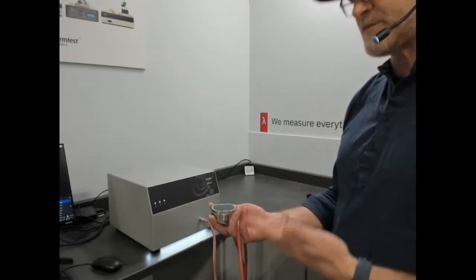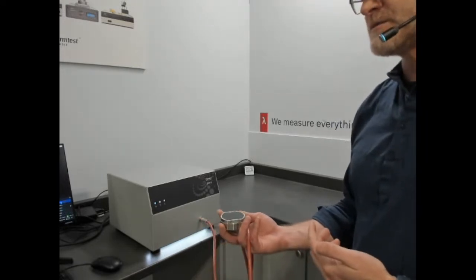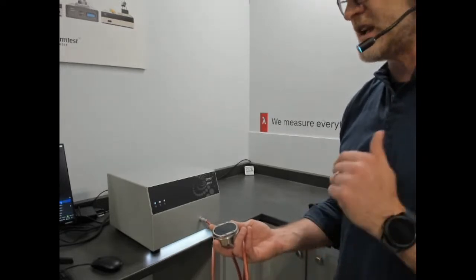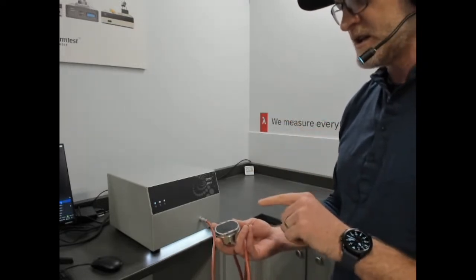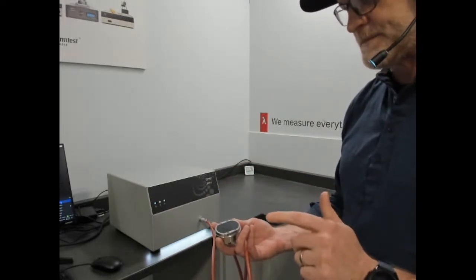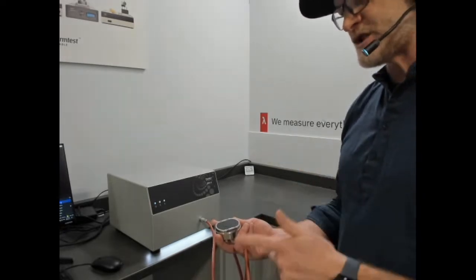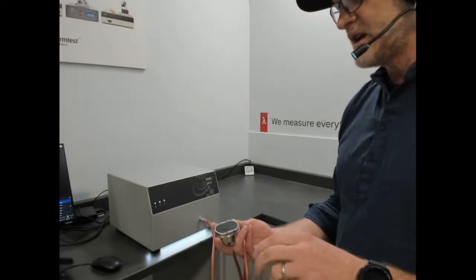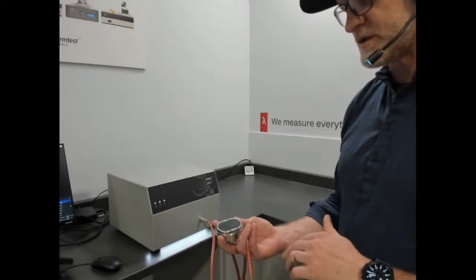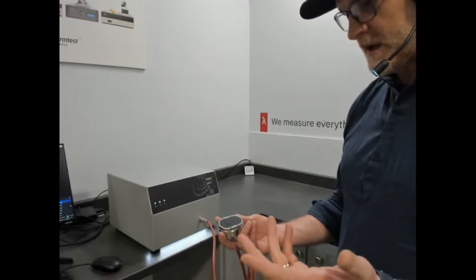So it does fit, but at the same time it doesn't, because it can be very confusing if somebody were to take that exact same measurement approach and consider that standard and be interested in backing the thermal conductivity out of the thermal effusivity value. So with the 7984 standard, as well as the measurement of textiles and fabrics, the thermal conductivity can never be backed out of that, because by the very nature of all of those materials being heterogeneous, the thermal conductivity inside the thermal effusivity is just not accurate, even close.